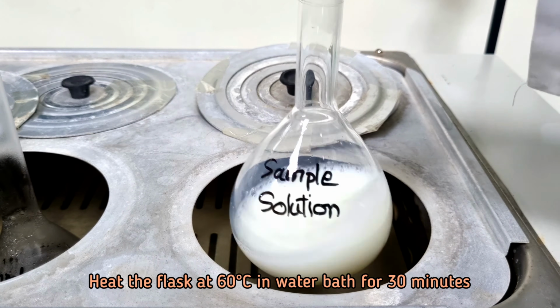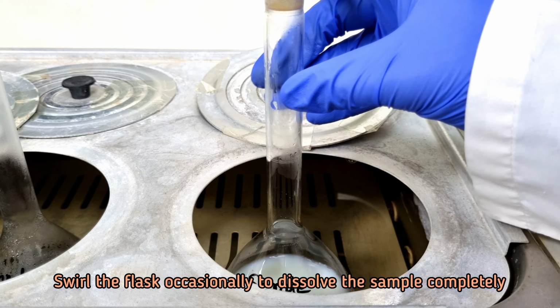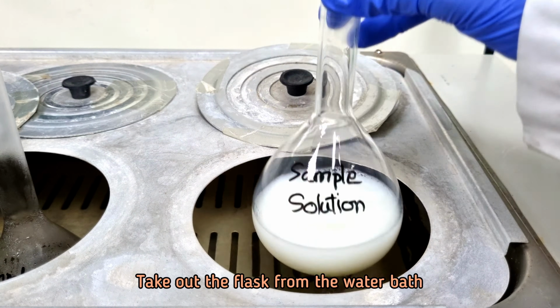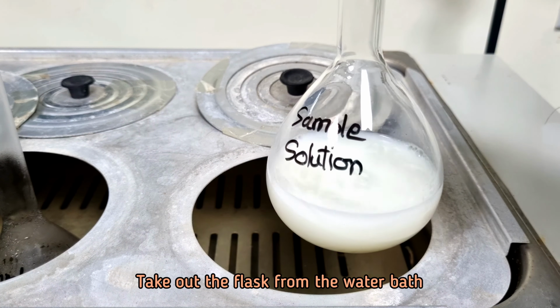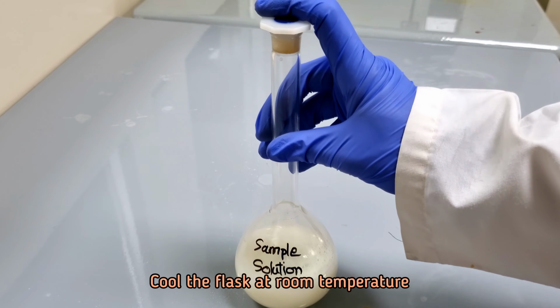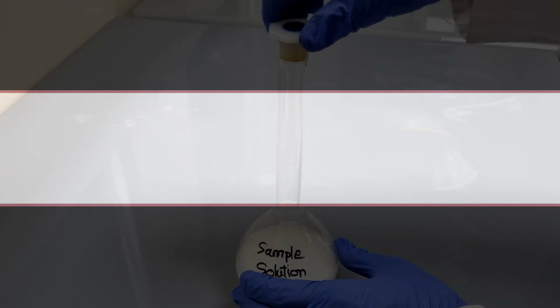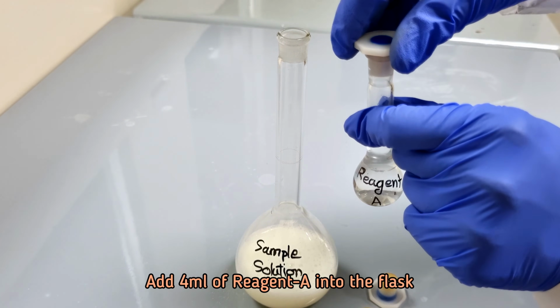Heat the flask at 60 degrees Celsius in water bath for 30 minutes and swirl the flask occasionally to dissolve completely. Cool the flask at room temperature. Add 4 ml of Reagent A into the flask.